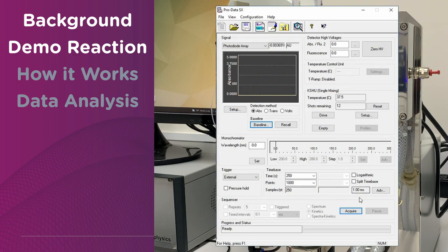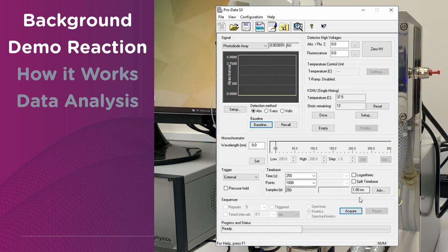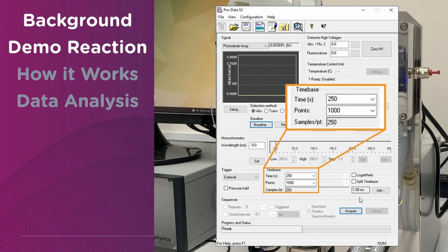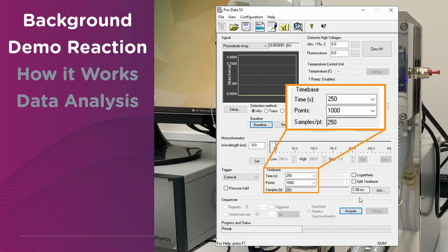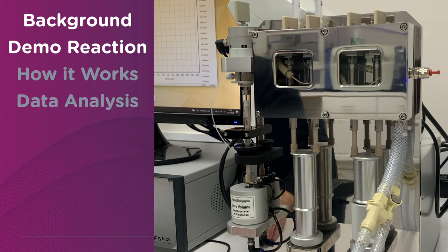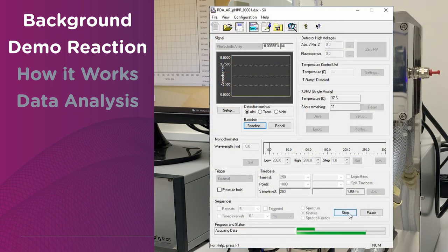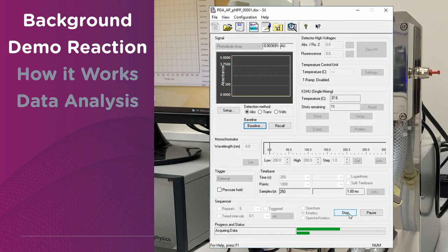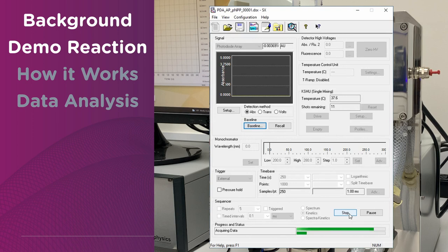After, we select our experimental conditions. Depending on the speed of the reaction, we set an appropriate acquisition time window. In this case, our observation window is 250 seconds. Finally, we press acquire. It's worth noting that the SX-20 is capable of recording reactions in the millisecond timescale, due to very short dead time. For this experiment, we also perform several repeats for validation.